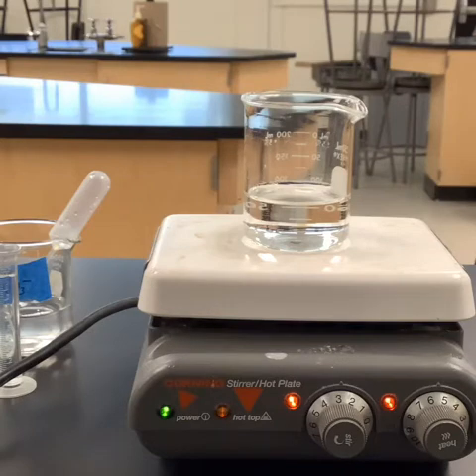Now, when you stir this, remember that since we're finding the rate, we have to be really careful to hold certain things constant. We want to make sure that we don't add any catalysts. So I've made sure to wash everything in distilled water to make sure that there's no metal catalysts left behind from tap water. I don't want to stir faster in one reaction than I do in another. I want that to be pretty constant, right? We want to keep the temperatures the same. We want to keep all these different things the same. The only thing we want to change are our concentrations.